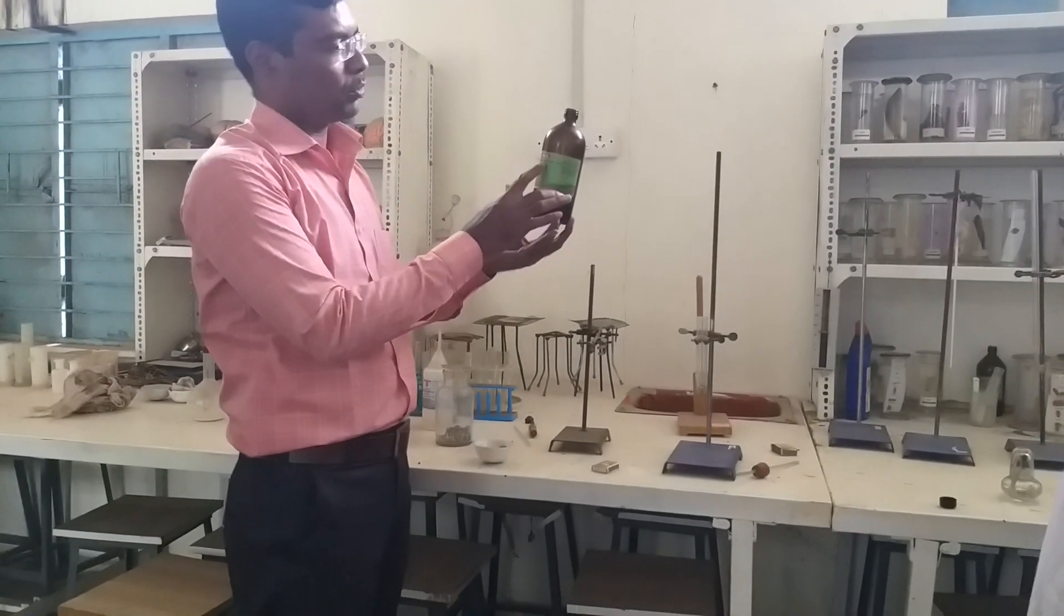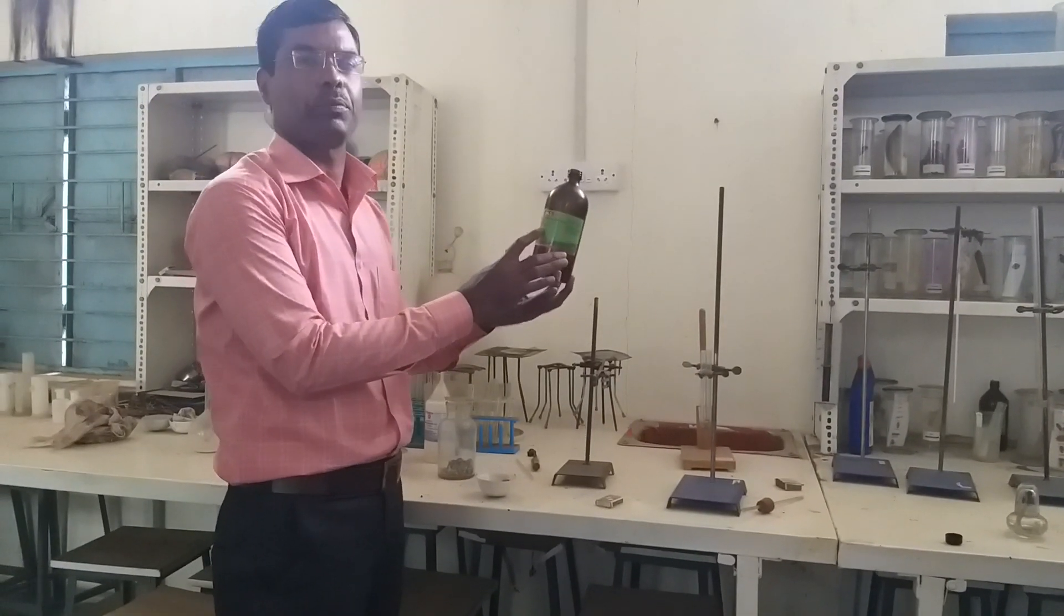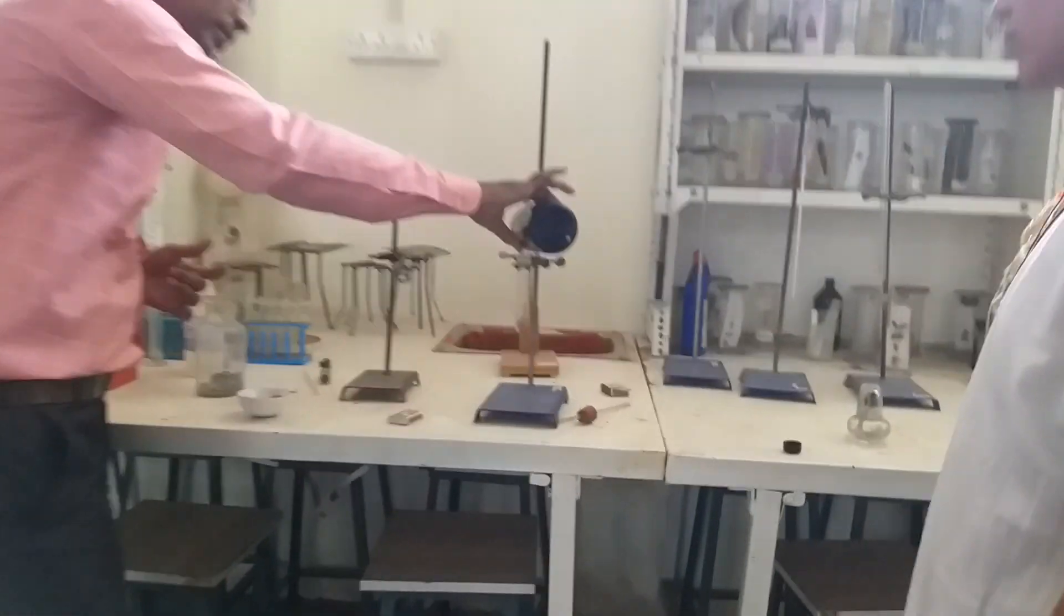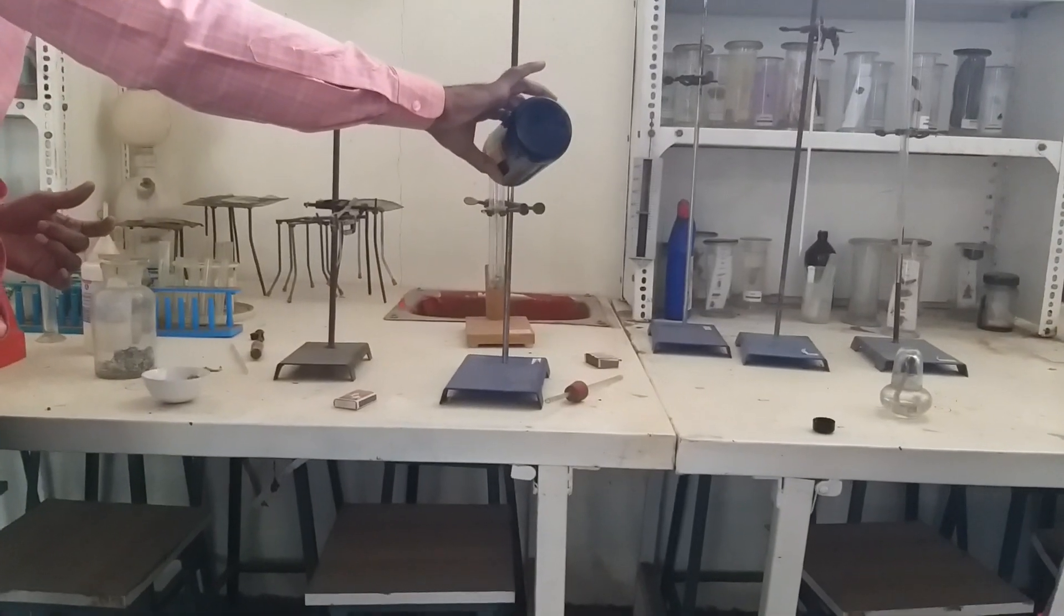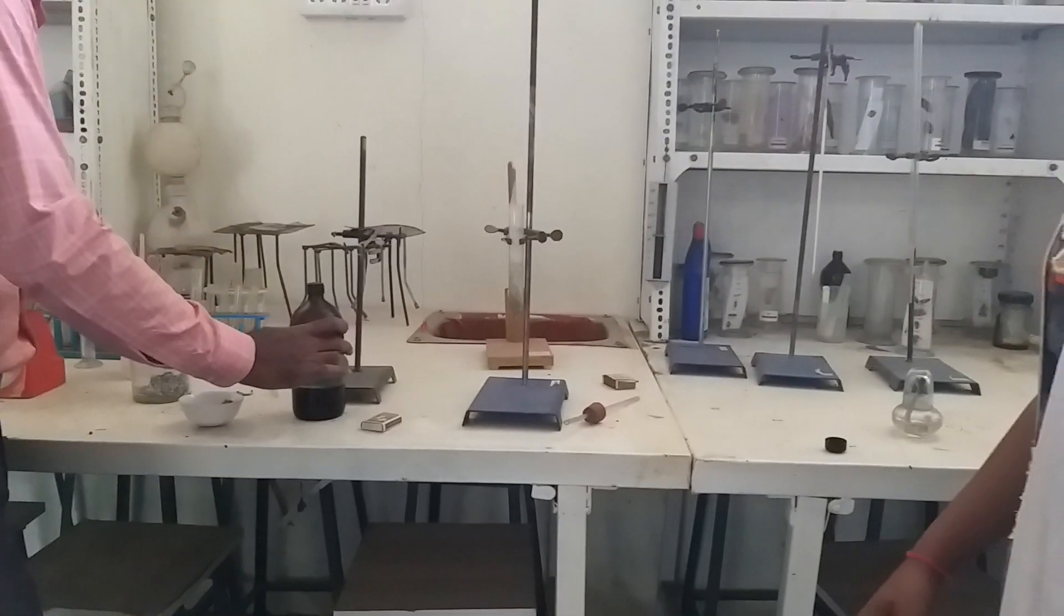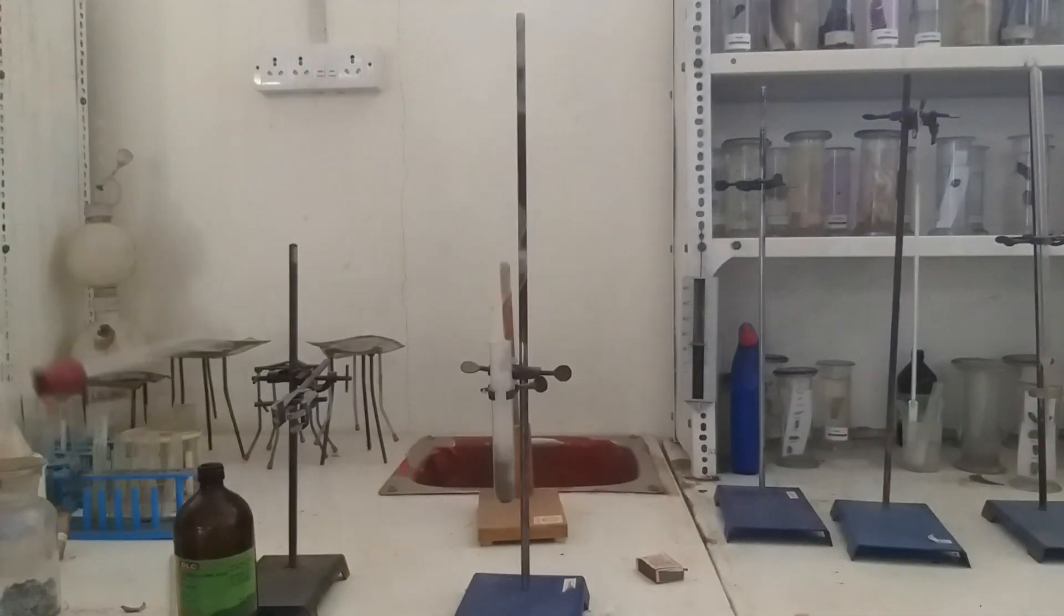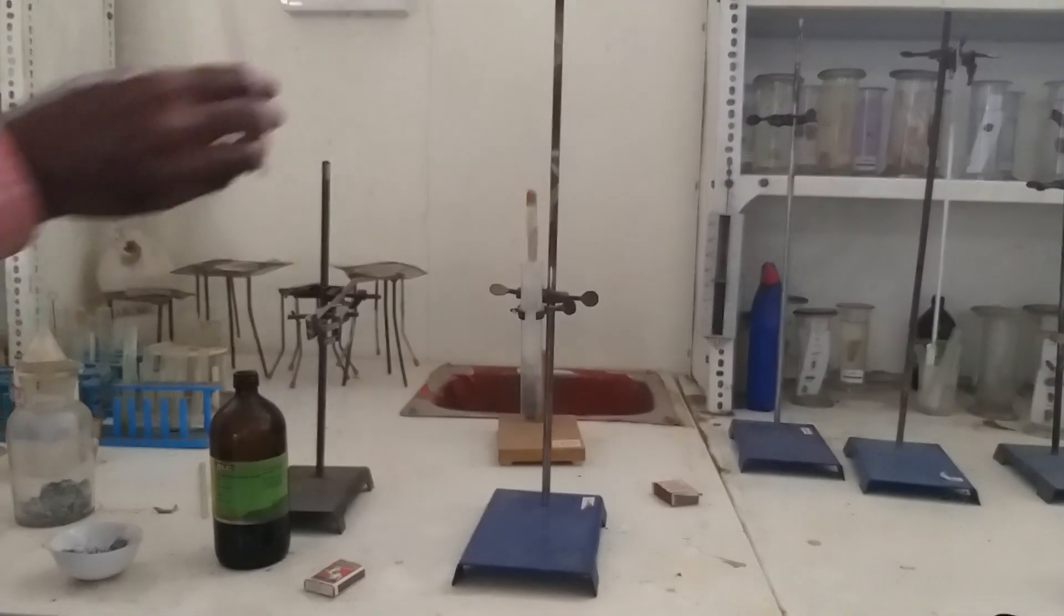This is hydrochloric acid which is extra pure. And we have to add this acid to observe the reaction. See what is the reaction. The quick reaction starts. The hydrogen gas comes out.